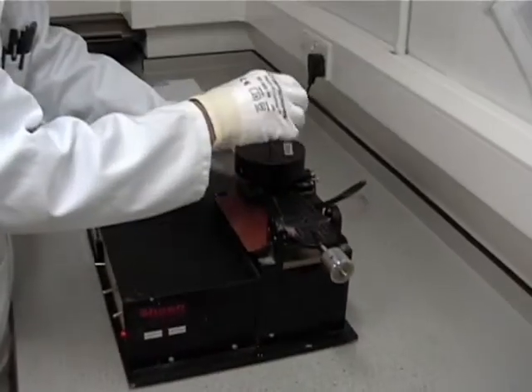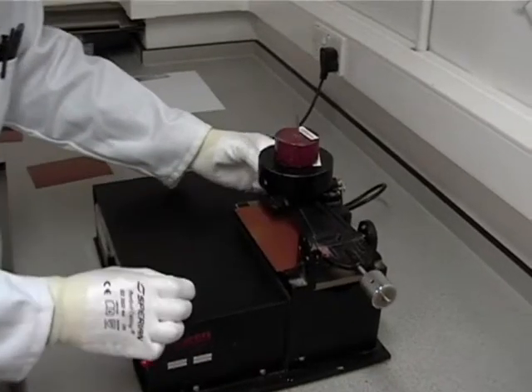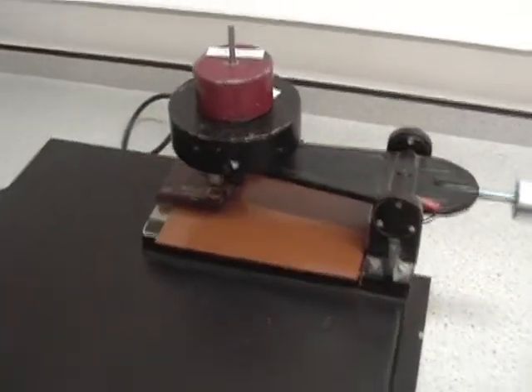Weights are successively added to increase the force on the needle and a new scratch is made each time.